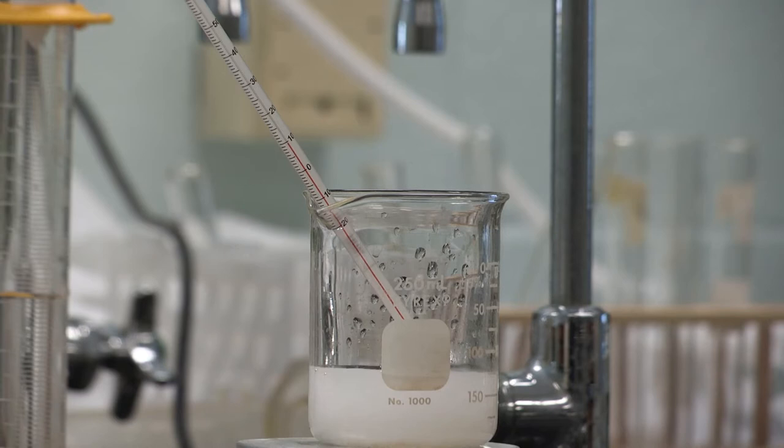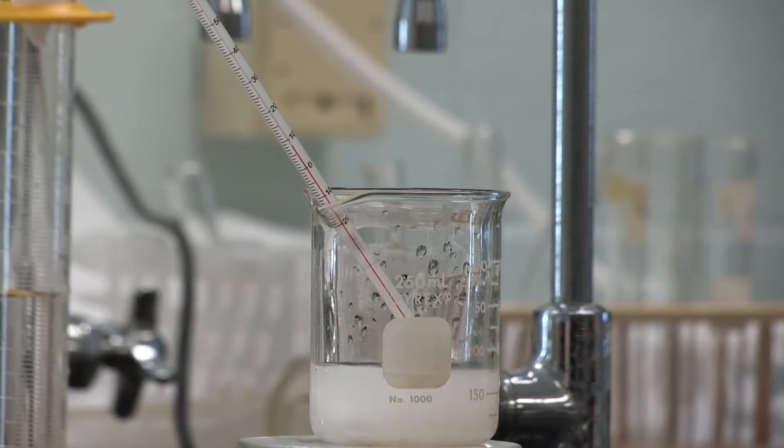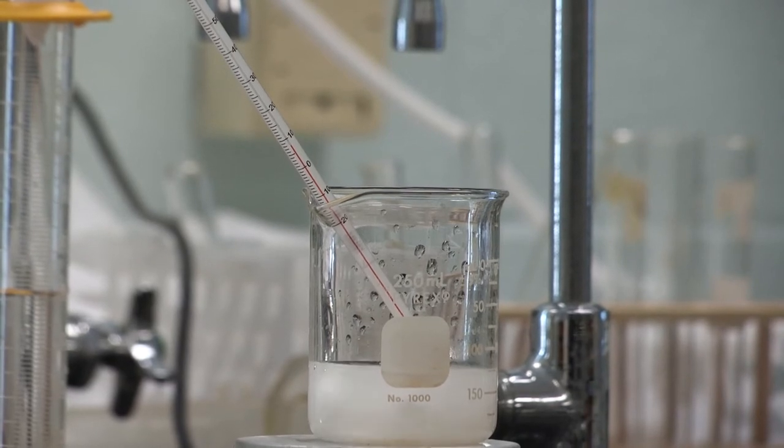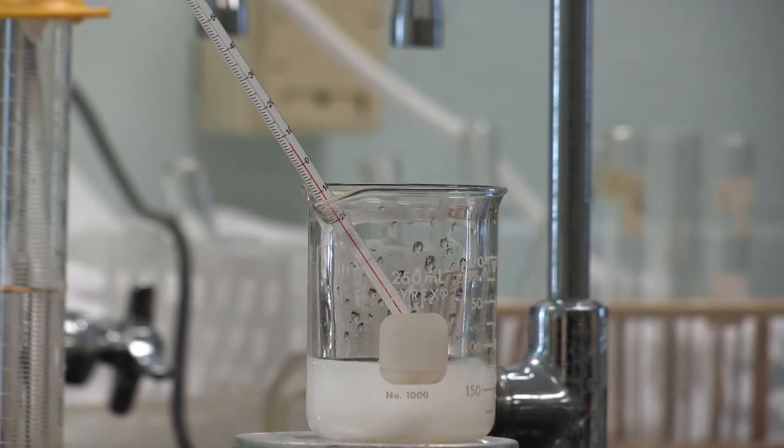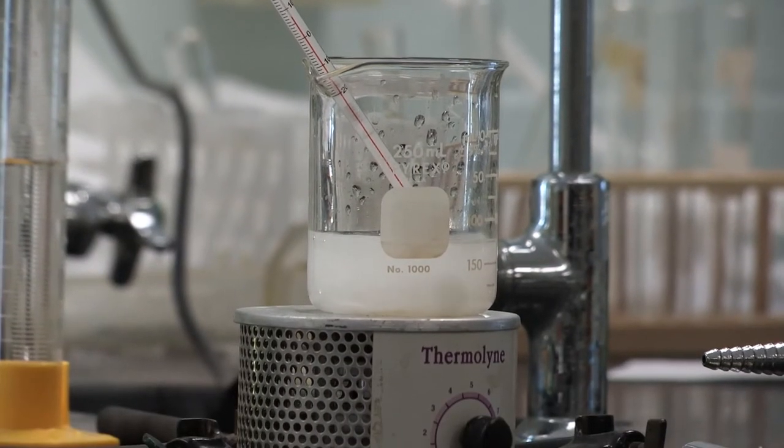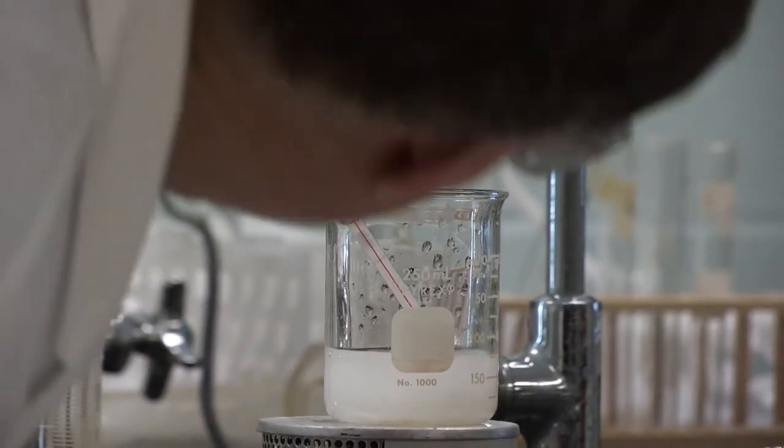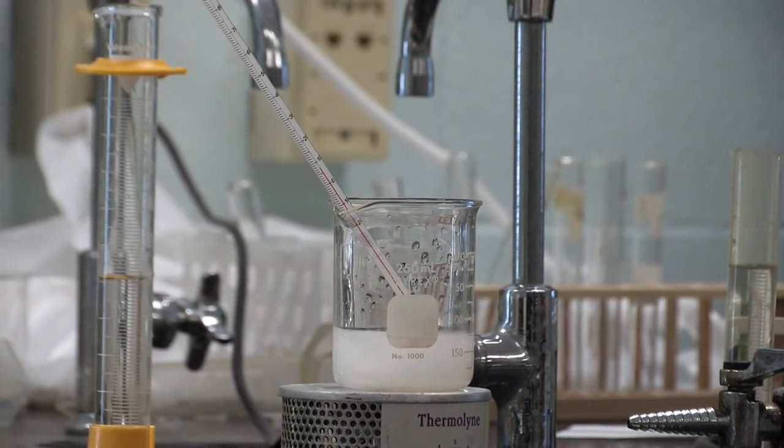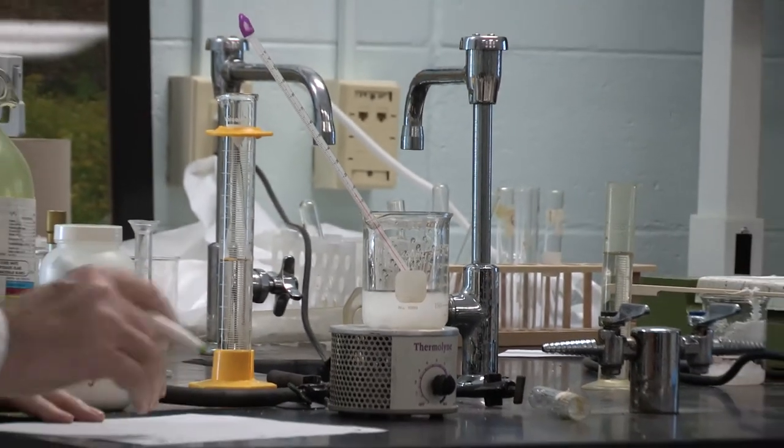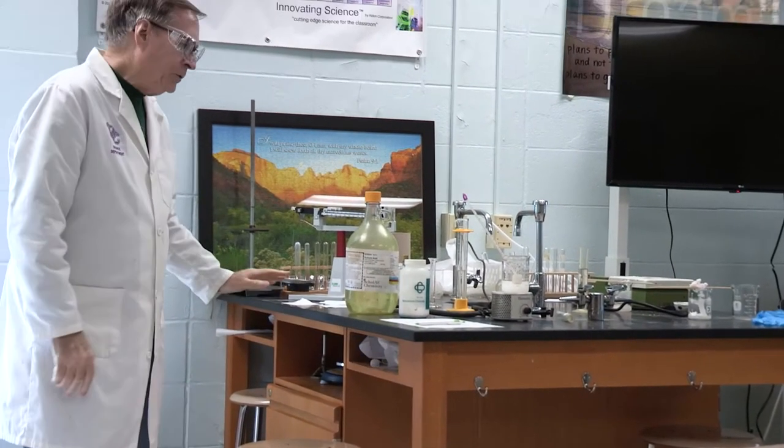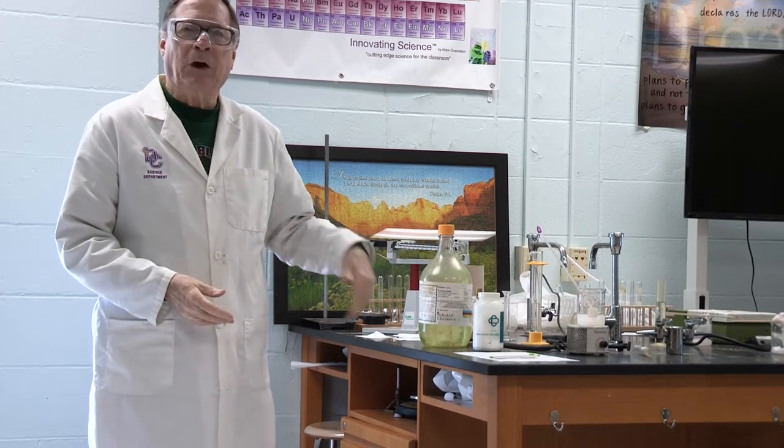At some point, even with stirring, we might end up with the solute being in the bottom of the beaker because I might make a saturated solution. Saturated is when it's holding as much of the solute as it can possibly hold. Can you see there's like a lot of big chunks that is just not quite dissolving? I think we've reached the point of saturation. Let's see what happened to our temperature. I'm thinking it's about 7.